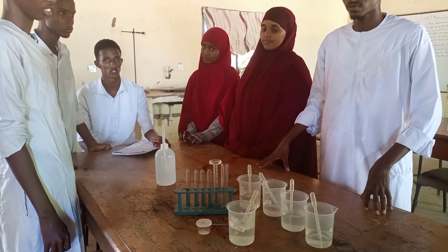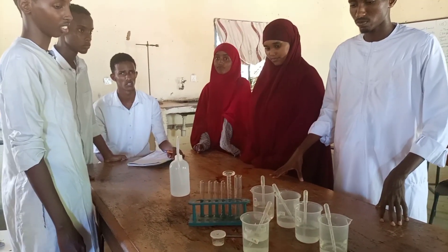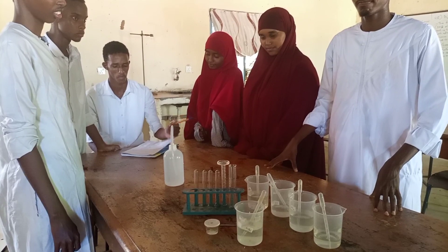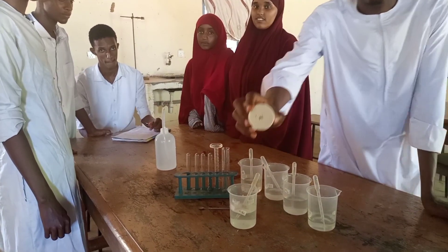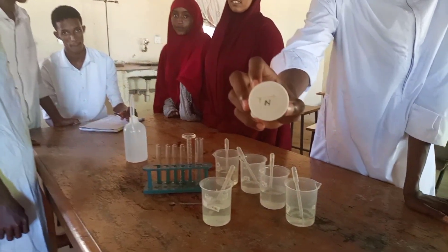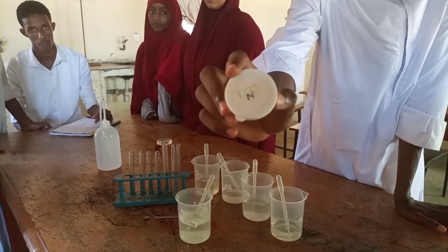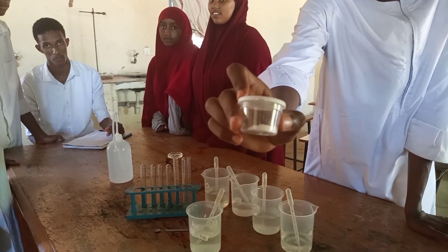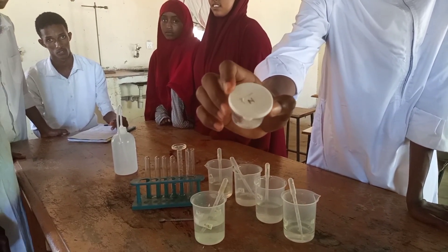Here we have some students who will be doing the practical for us. We will be analyzing solid N. We don't know what it is — it is an unknown salt containing a cation and anions.